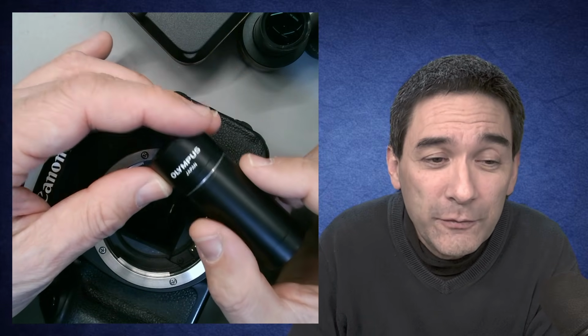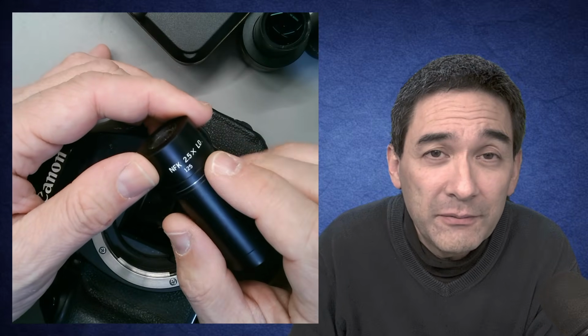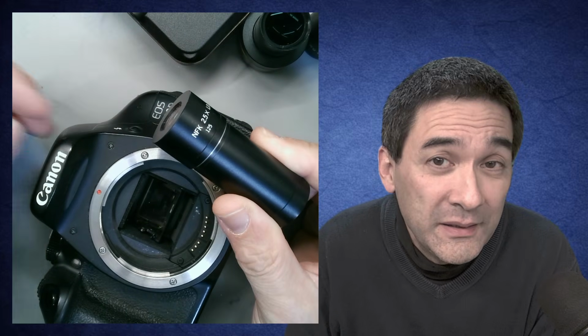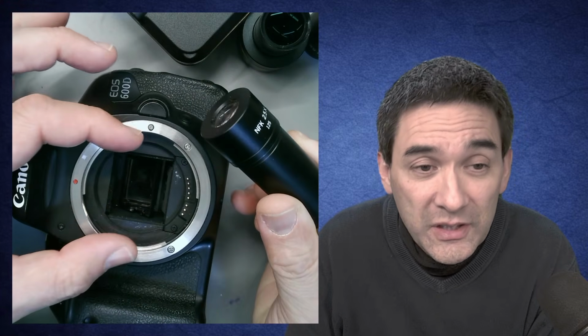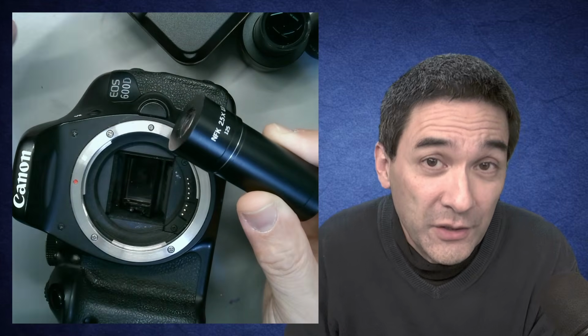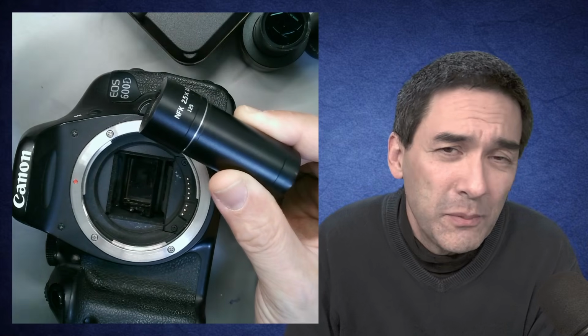A little bit of side information over here. This photo projection eyepiece with a 2.5 times magnification was actually made for so-called full format cameras, or back in the analog days, 36mm film. And this was significantly larger than this one over here. So if I use this eyepiece with this camera, it does work. I do get a little bit of empty magnification. It magnifies more than necessary, but it still works.